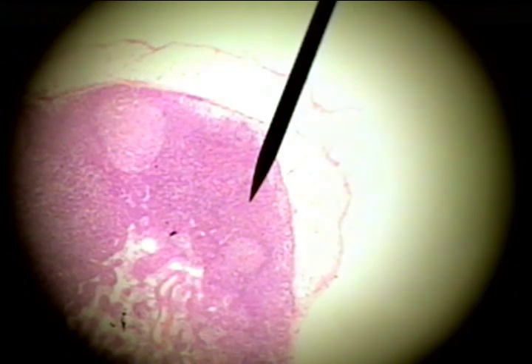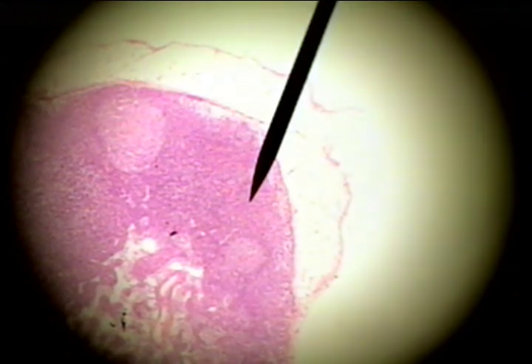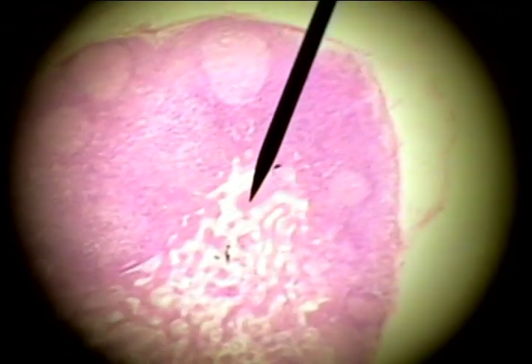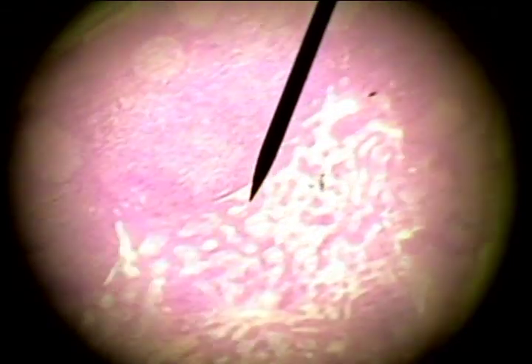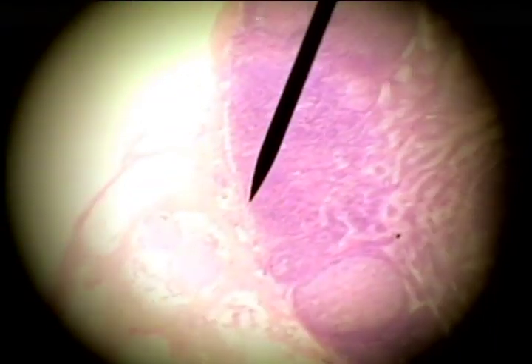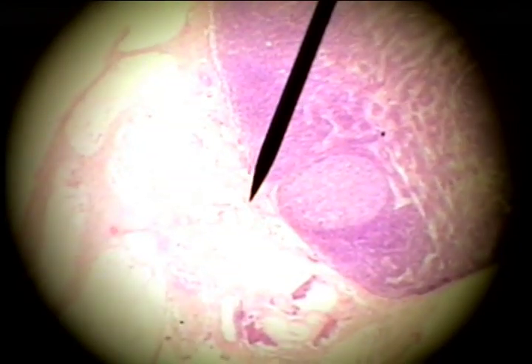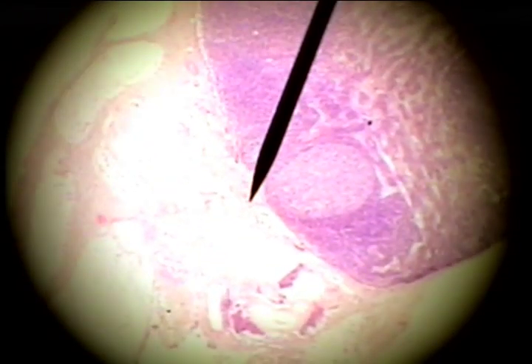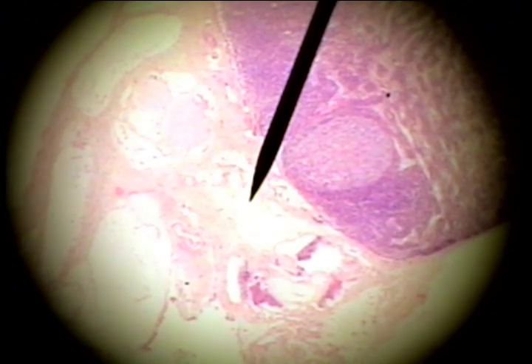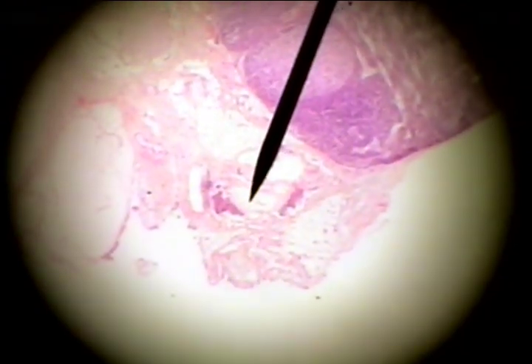This first organ is the lymph node. The lymph node is an oval structure, and as we scan down the length, we'll come to the opposite end, which is the hilum or hilus, and it has arteries and veins.